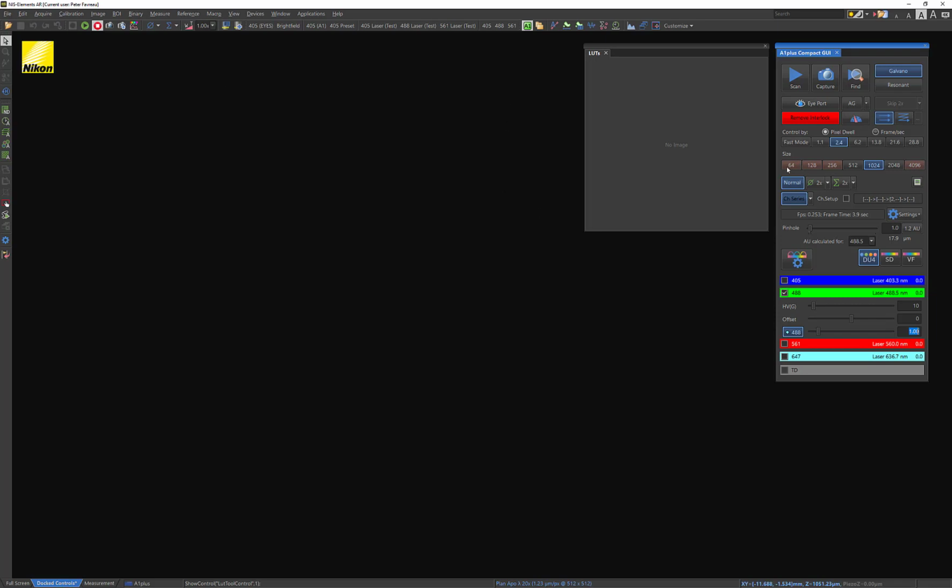You can go all the way down to 64 by 64 pixels, which will, of course, sacrifice resolution, but it will rapidly speed up your imaging. Usually for actually taking publication quality images, I suggest anything from 1024 and above. I kind of think that 4096 is overkill, but for some people, they really want those high resolution images. And they want to select that. But I think anything above 1024 or 512 for that matter will be great for acquiring images for publication quality.